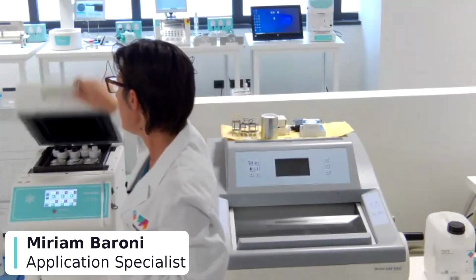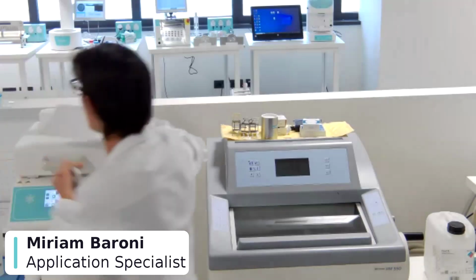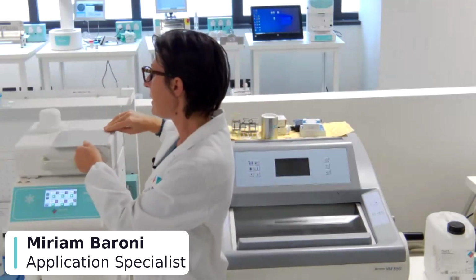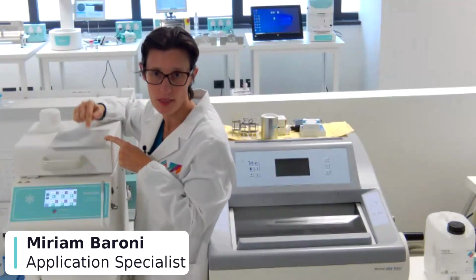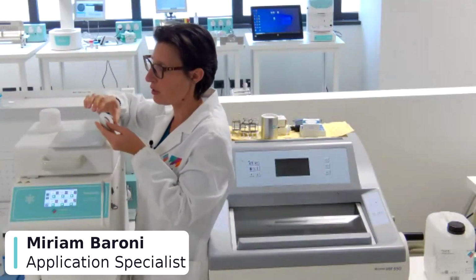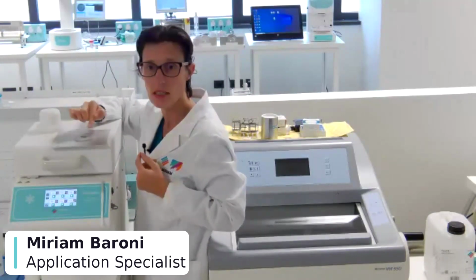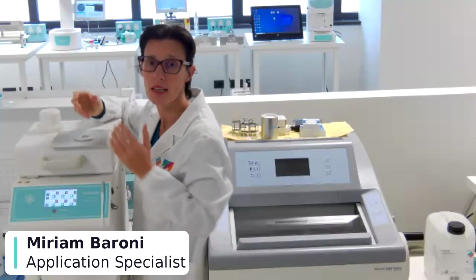So in the cryostat, it's easier to position it correctly. The other protocol that we use is to put inside the Presto Chill a flat surface like this one. And when it is at -40 degrees, it's possible to put the Mohs sample, the skin sample, directly on it and push down all the margin in order to have all of them at the same level. Then we use this ring to create a sort of mold and side around the sample. We fill with the medium, put the chuck, and we create the block.